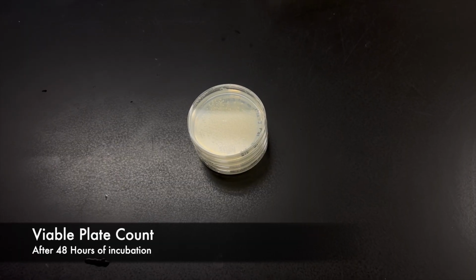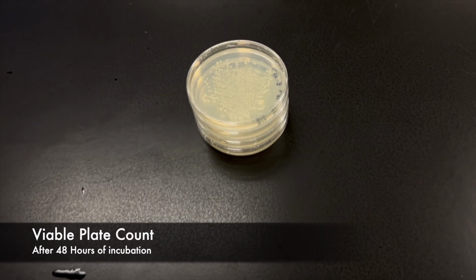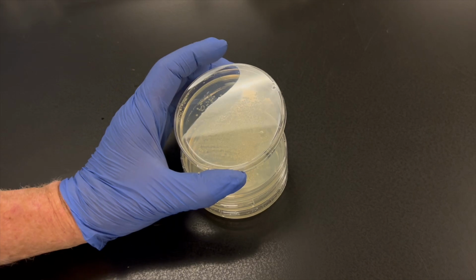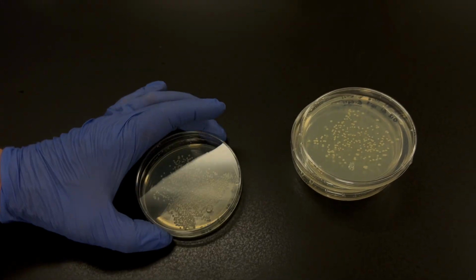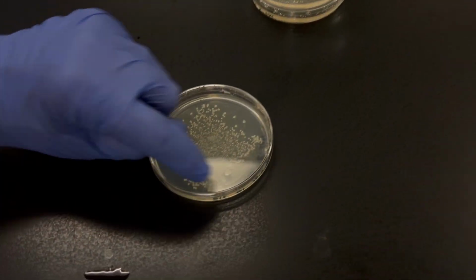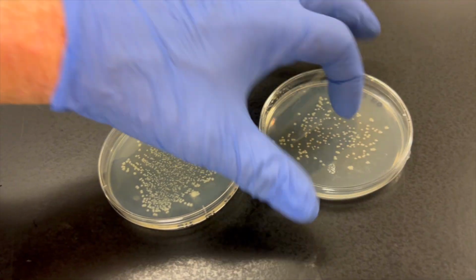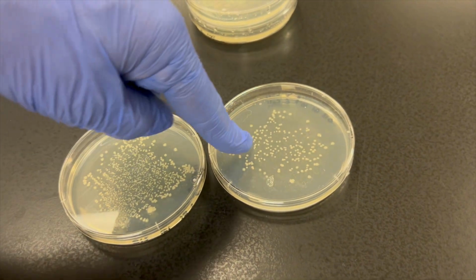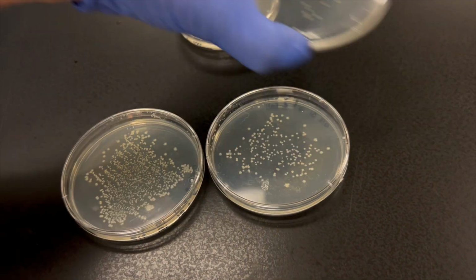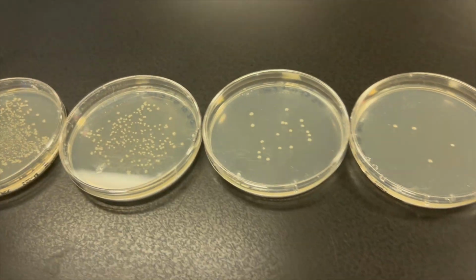Okay, so we've now had 48 hours pass in the blink of an eye. And we're now ready to look at the results. So we have our 4 plates here. Here's our 10 to the negative fourth. We can see a lot of bacteria on here over the plate, definitely more than 300 colonies. Here's our 10 to the negative fifth. This might be the one that we have to count, right? Here's our 10 to the negative sixth and our 10 to the negative seventh.